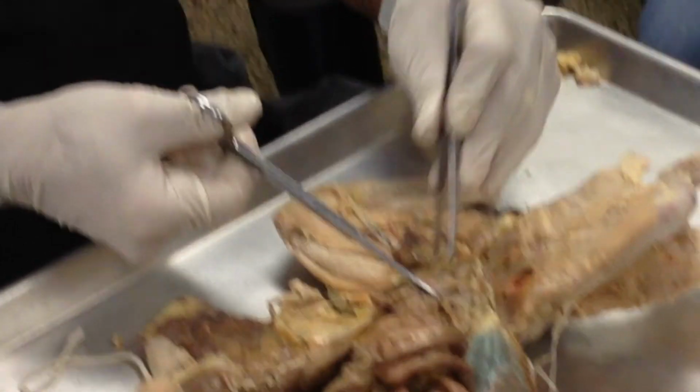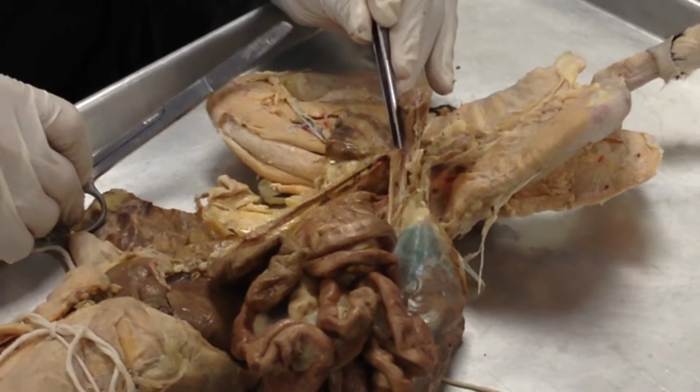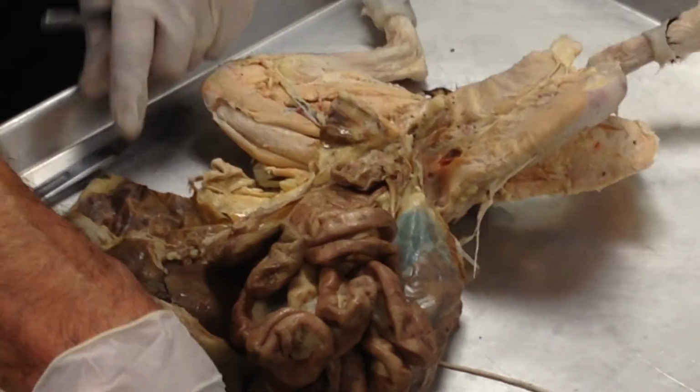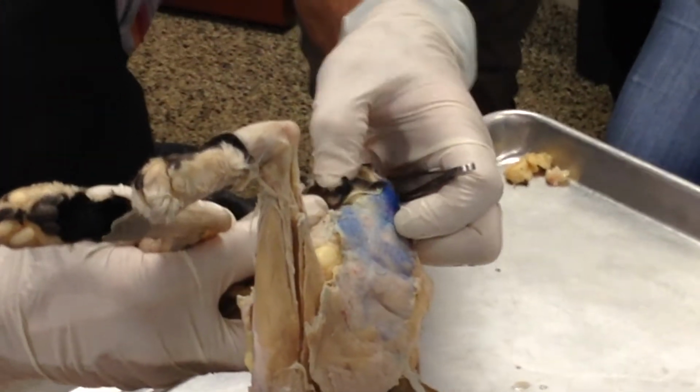And then behind that, so there's actually 3 tubes right there, because behind that is the rectum. 1, 2, 3 tubes, right? And by the way, there is the vaginal opening right there. So there's the anal opening and there's the vaginal opening right there.